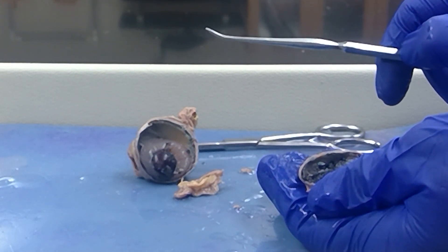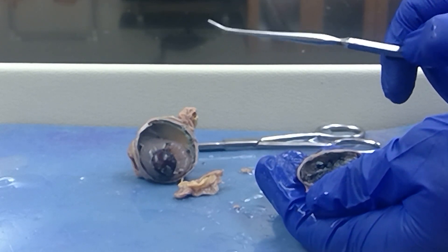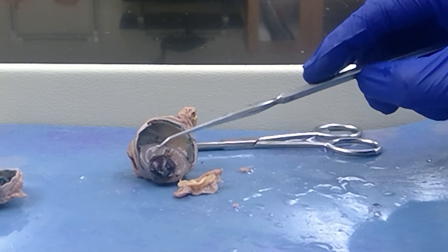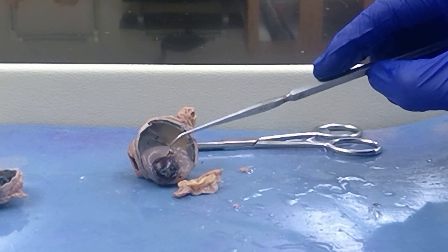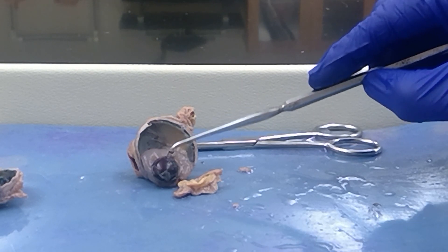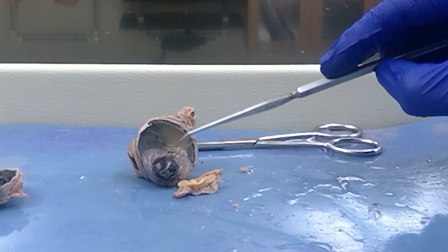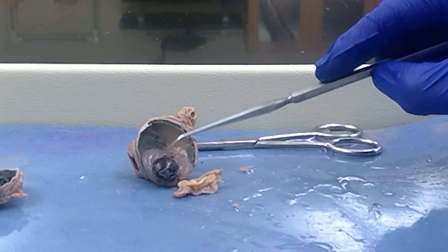When I give you a video on the eye model, it will be more clear. I'm going to remove the lens — that's this hard structure here. This jelly substance that is going with it is the vitreous humor. The vitreous humor is found in the posterior cavity, posterior to the lens.